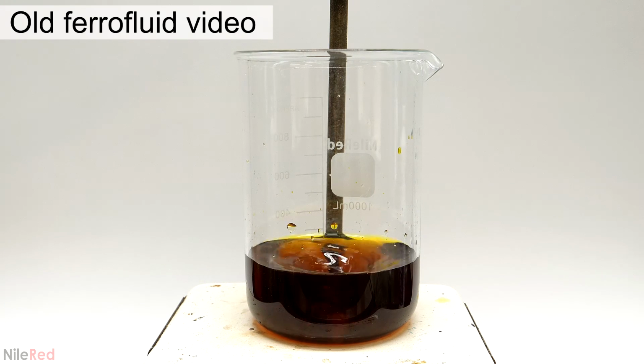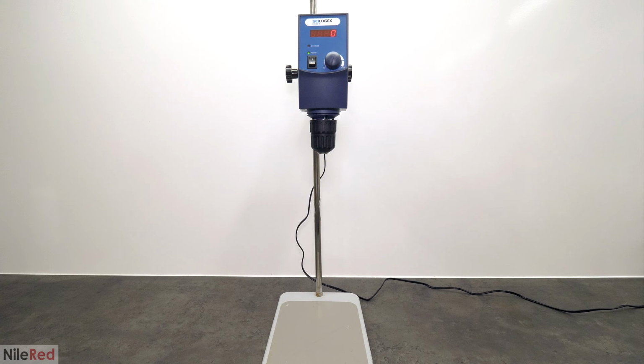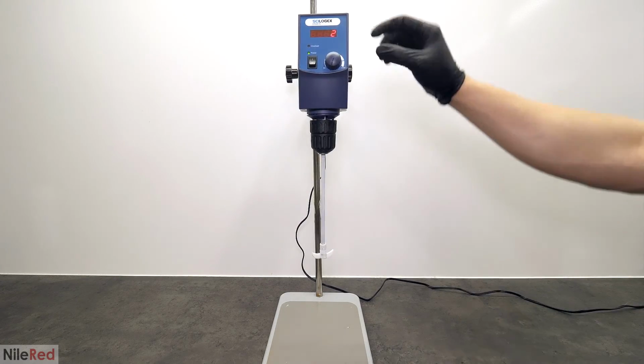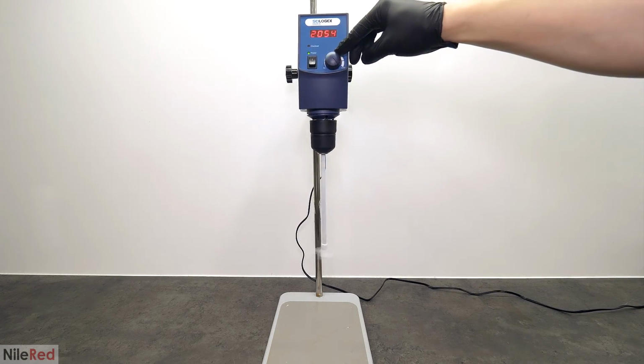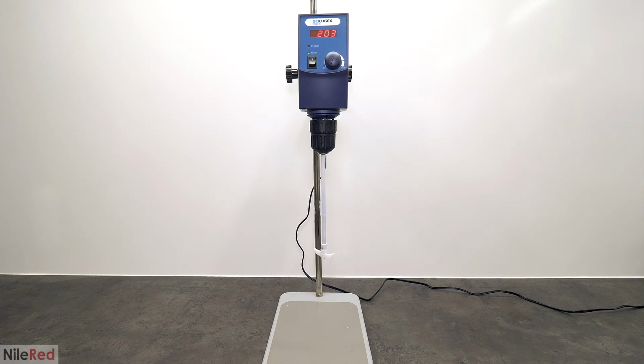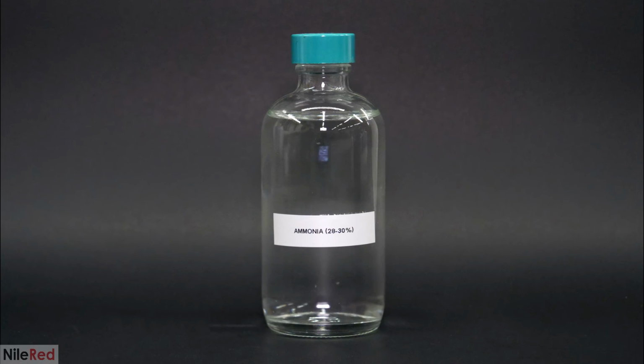In my last video, I used my hot plate to stir things, but I found that it wasn't nearly fast or strong enough, especially to do it on larger scales. So I went and bought a nice overhead mixer from Amazon, which was basically just a high-tech milkshake maker. Also from eBay, I picked up a cheap Teflon-covered stir rod. Okay, so now equipment-wise I was all set up, but to actually make the magnetite, I just needed one other ingredient. This was concentrated ammonia solution, which is usually around 28%, and I picked up mine online.